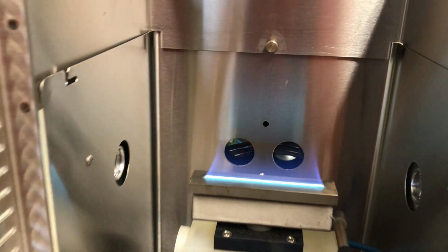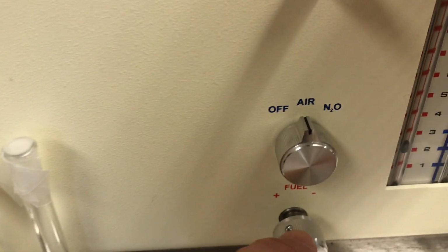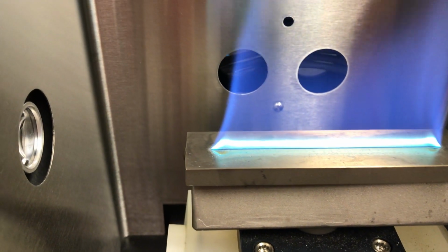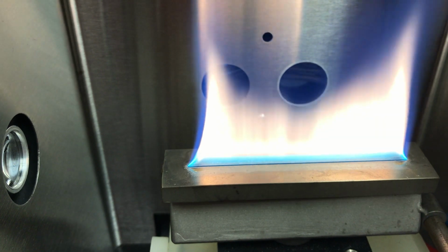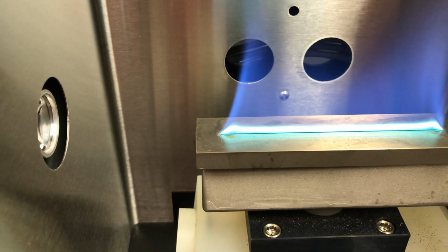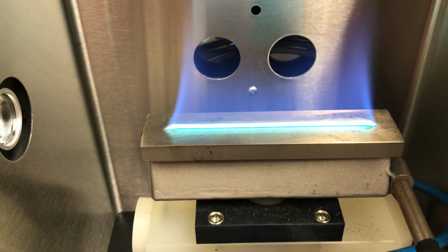All right, just to show you the effect, this is a nice hot flame that I've got here, and I can tell by the color of it. I can actually increase and decrease the flow of the acetylene. So I'm increasing the acetylene flow here. And I want you to see what happens to the flame as I do that. Okay, and at some point the flame becomes sort of yellowish and cool. So this is a very inefficient flame here. So I want to bring that acetylene level back by rotating that knob to the right, fuel adjustment knob, until I've got a nice hot flame with a nice inner cone. Okay, and you can see that. That should be about optimal for analysis at this point.